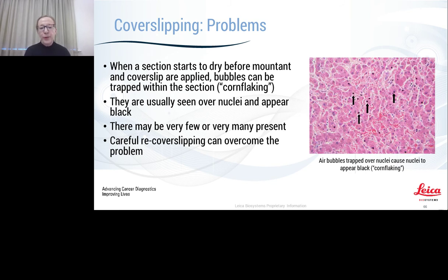Another thing that people commonly are very confused about is seeing the appearance of dark nuclei that appear for no good reason. Sometimes we call it cornflaking, when that's actually air that's over the nuclei. And it's because the section has been allowed to dry out. This could be in a commercial cover slipper or just in your bench staining. But just be aware, if the slides do start to dry out, you might get these tiny little dark areas over the nuclei, and it's actually air. So re-cover slip.